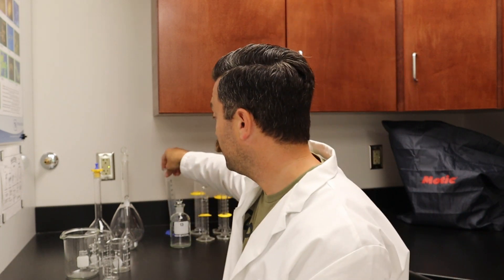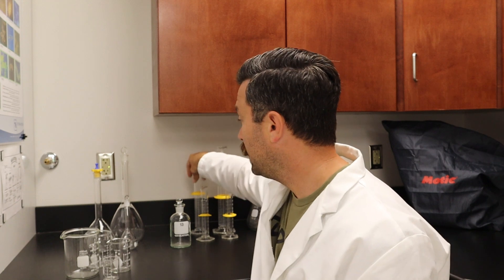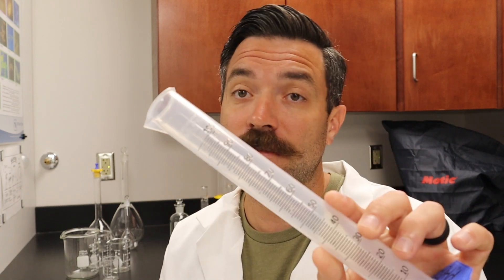Before moving on, let's talk about plastic versus glass. One thing you should remember: glass is always going to be more accurate than plastic, because of the way the glass is made and etched. If all you have is plastic in your lab, that's okay — it'll still get you close. But if you're asked what's more accurate, glass or plastic, glass is your answer. Always.